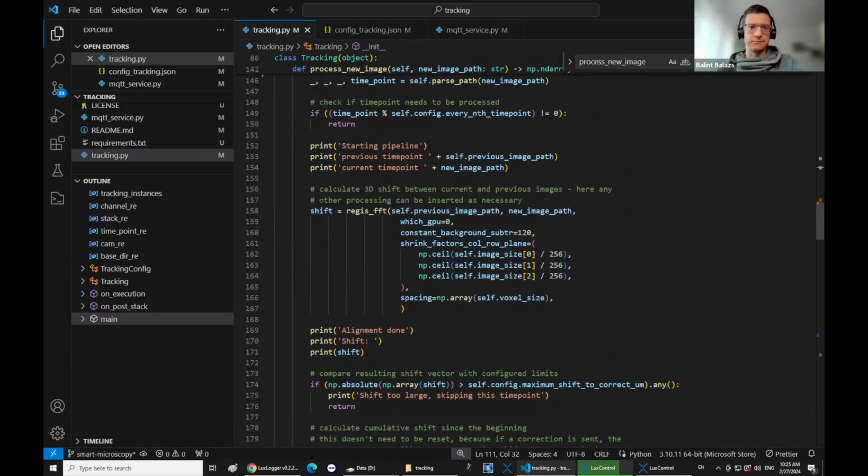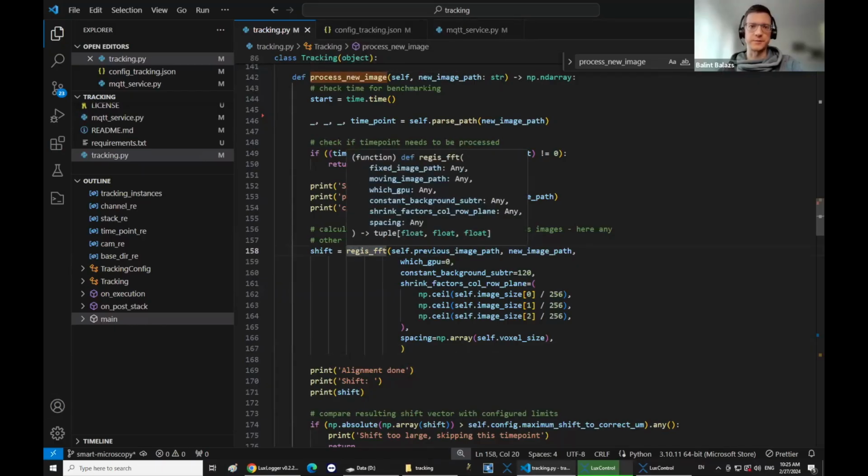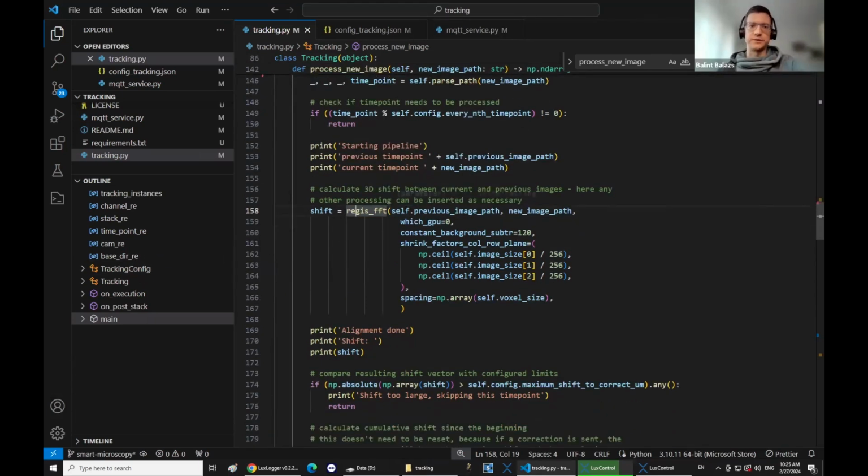And then when the new image comes, it does some parsing and basically passes it to this registration method. Unfortunately, this is a very old script, so I didn't find the actual registration script, but I don't think, to understand the whole script, it's super important what this thing exactly does. Basically it just returns a tuple of 3 coordinates x, y, z that has the shift between the previous image and the new image.